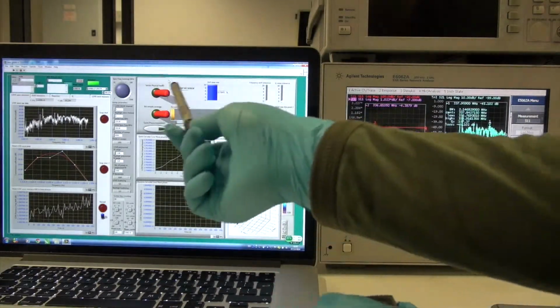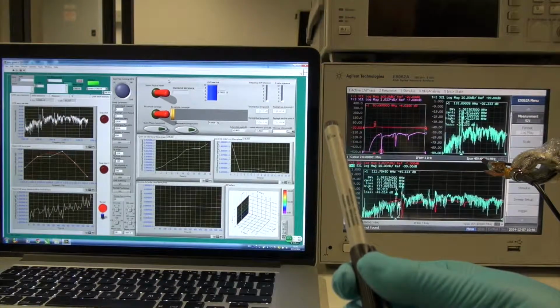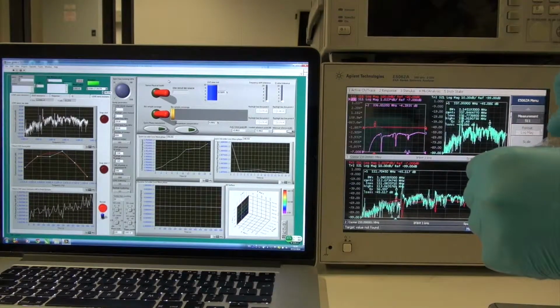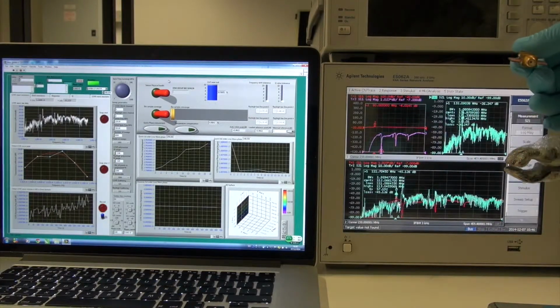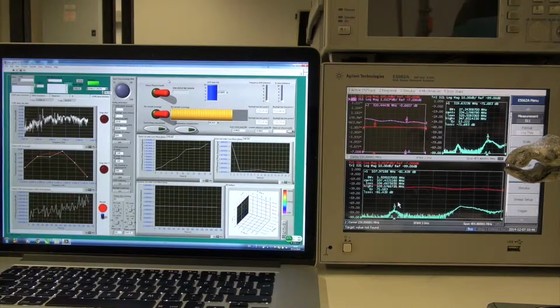So here we show this device, the zinc oxide layer left is 97%, which means this device is fairly new, so it's trustable for the measurement. But if we replace it with another device, which is the device we purposely etched all the zinc oxide layer on top, you can see the result.